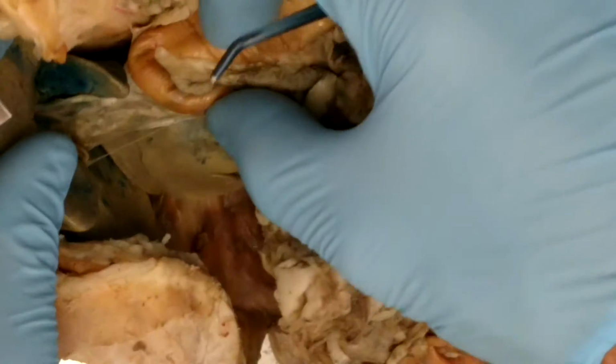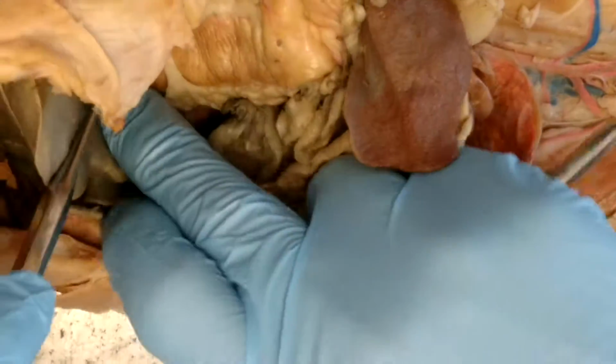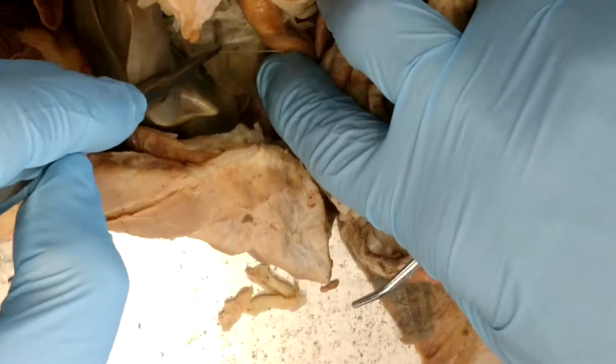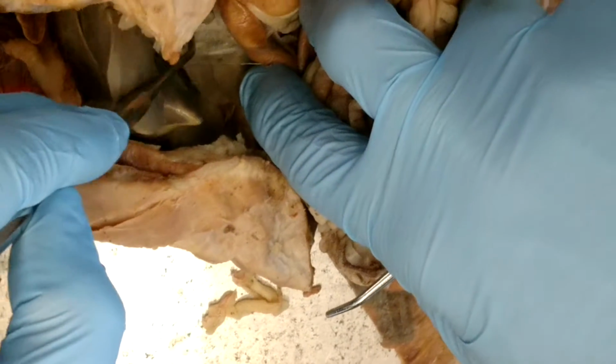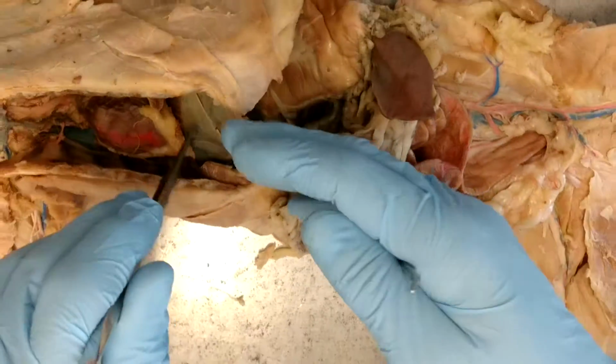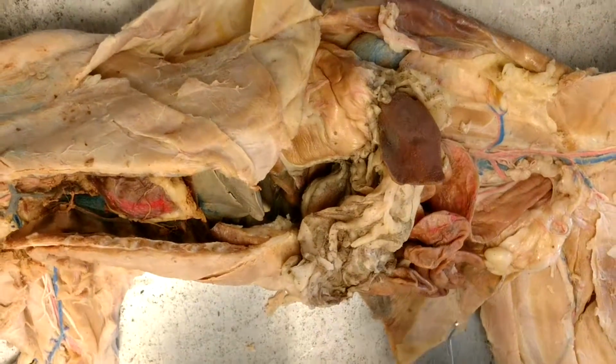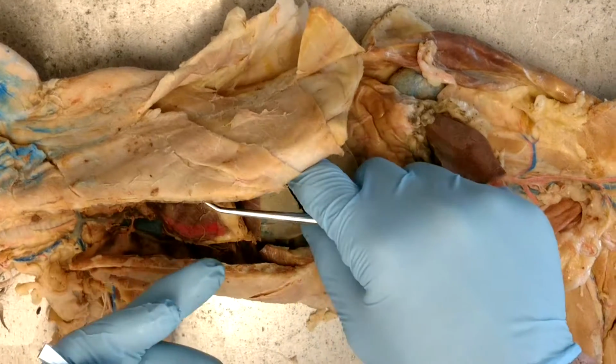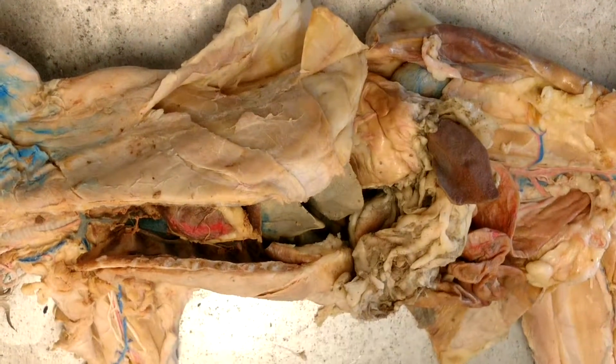right? And it doesn't get the blue dye, right? It's that kind of brownish, whitish colored vessel there, which you can't really see very well, and I don't ask my kids on a test. All right, so that's that vessel right there. That's the portal vein. Then it goes into the capillaries of the liver, and then back into the inferior vena cava by the hepatic veins, which are in the liver, so you can't really see them on the cat either. And that's the blood vessels of the cat.